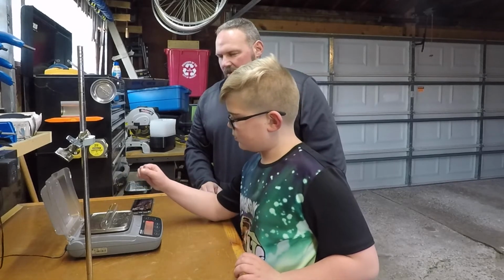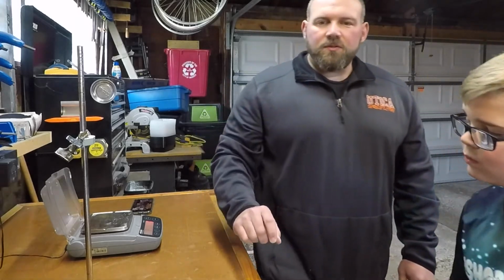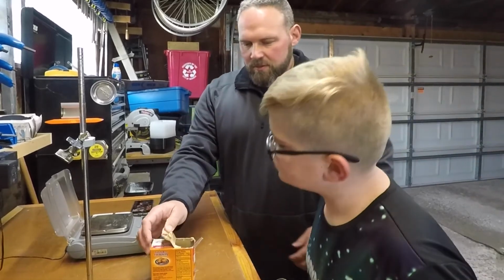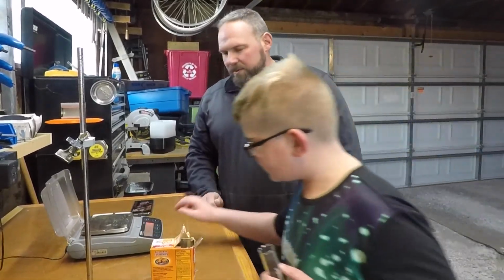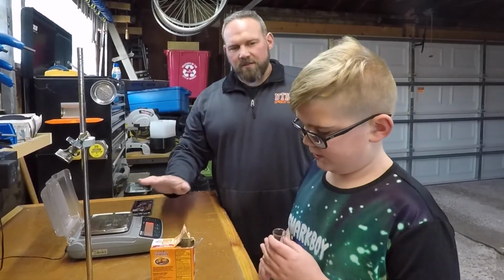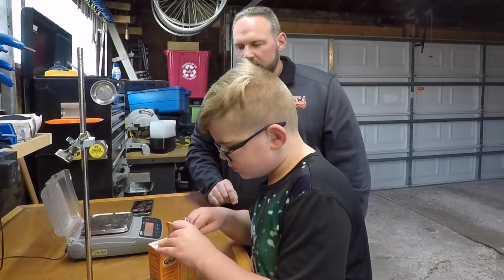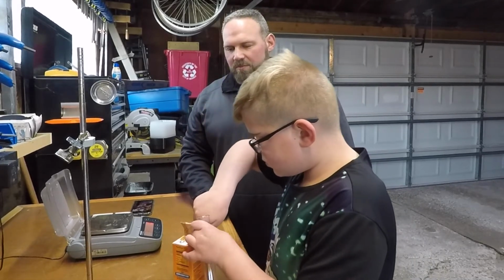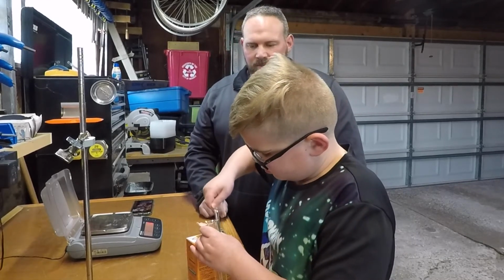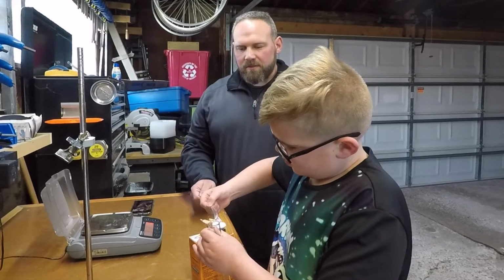Okay. All right, grab your test tube. Careful with it. Okay. Now we are going to measure out some baking soda. Okay. So why don't you scoop a? No, you leave it, because when you put the test tube back on, it's going to take care of that. Okay. All right. So go ahead and get a scoop of sodium bicarbonate, otherwise known as baking soda. Okay. Remember I said go that way. There you go. All right.